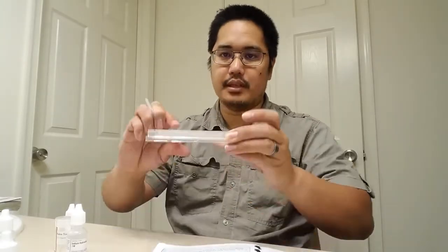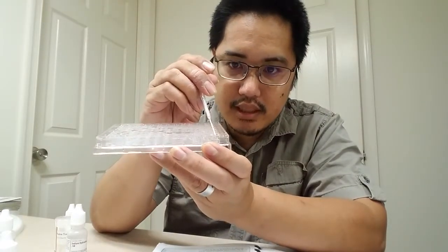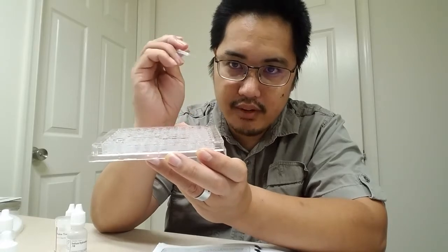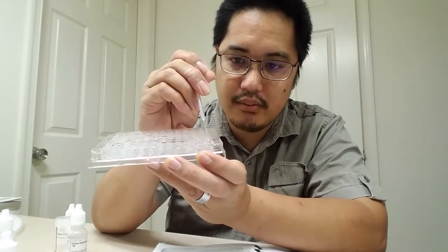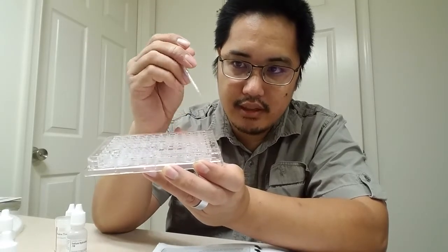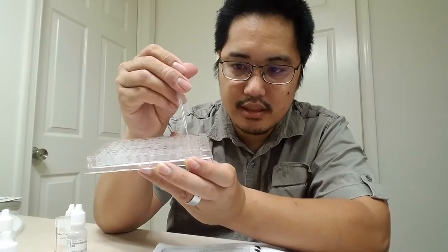So what I did was I have pure hydrochloric acid in A1. And then I put 1 drop from A1 into A2. And then whatever excess I had in here, I put it back into A1. So now I have a clean pipette. Then I take this A2 and I take the contents and I swish it around like this. And I put it back.